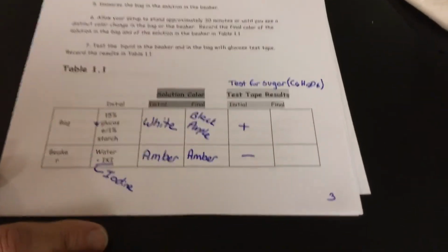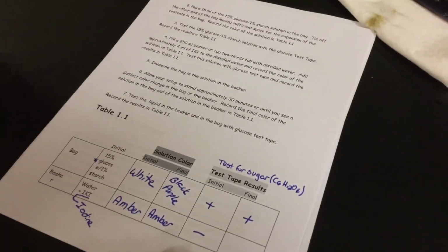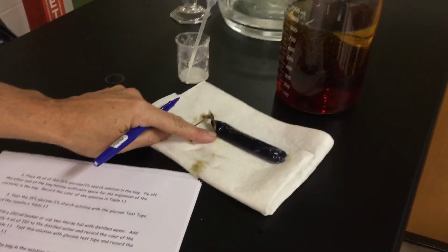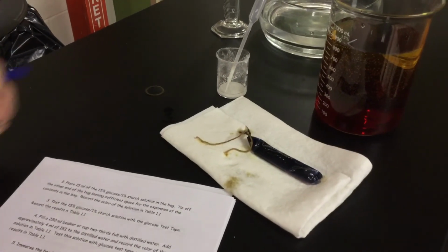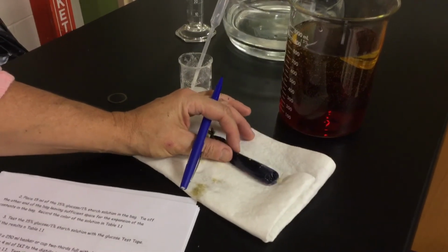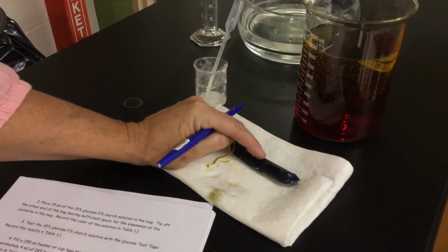We tested with test strips, and we're going to test for sugar. So inside the bag, I still have sugar. It's still positive in there. My glucose outside, I'm going to say it's negative here. It did not move out. So even though we think of sugar as this tiny little molecule, it's still too large to fit through that particular membrane. So if this had been our cell membrane, it may need help with maybe facilitated diffusion. Maybe it needs helper molecules to move through. If this was a cell membrane, that glucose in this example would not be able to go through that phospholipid bilayer. Iodine absolutely did. It absolutely moved through into there, and we could tell by this color change.